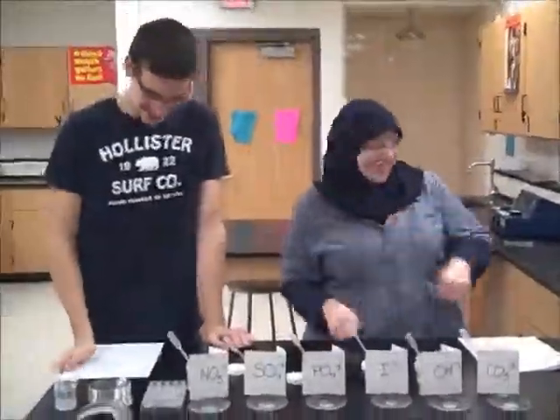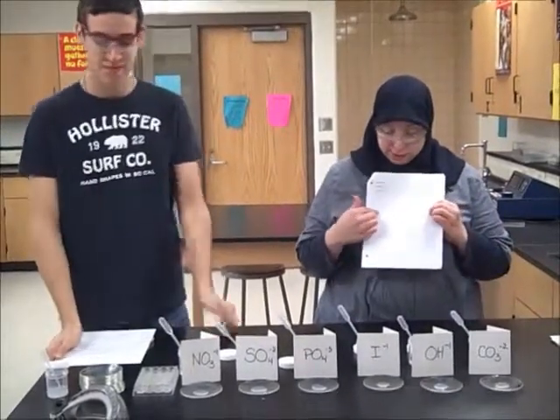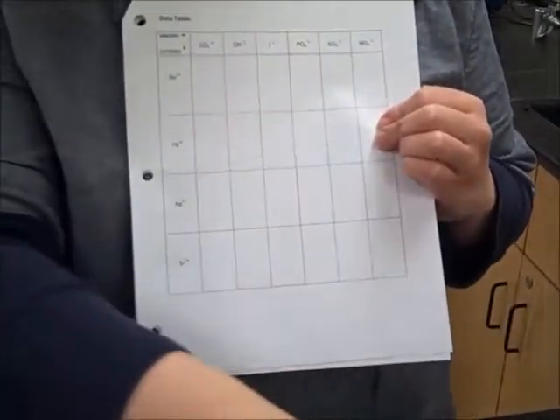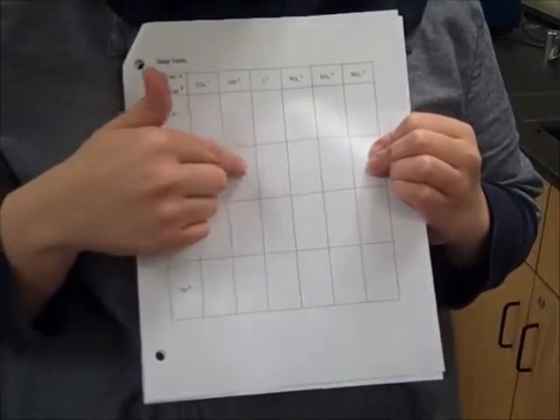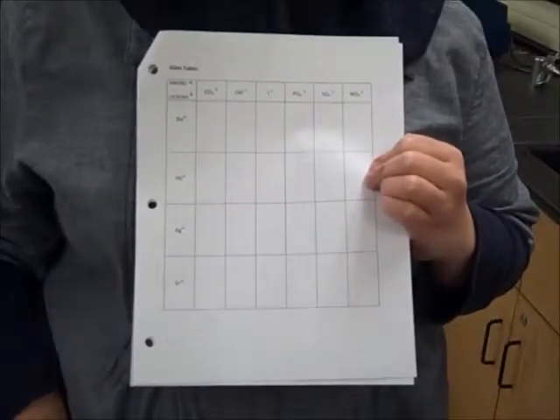All right, row 2. We're going to be working on the Pb plus 2 row now, so we have it all set up. So this is the row we're going to be doing now. So the lead is actually already on there, and we're going to add the ions, the negative ions, into the wells or onto the watch glasses to see the reaction. Okay? Okay. Here you go.